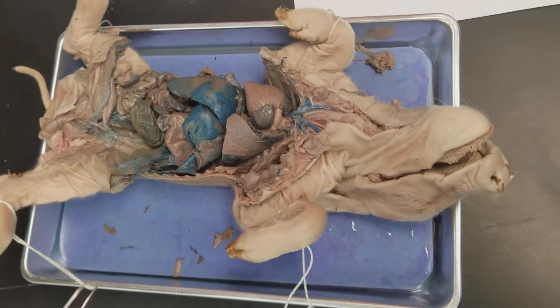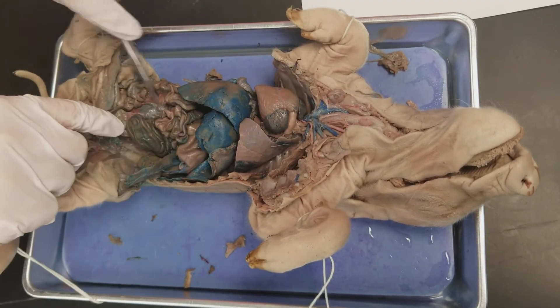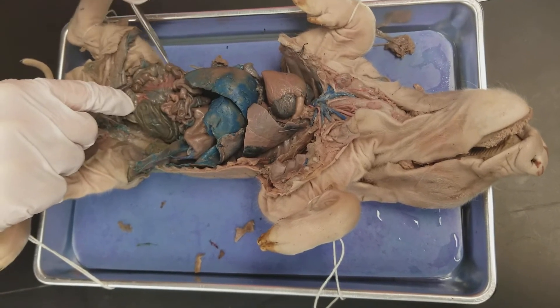The mesentery is what holds together the small intestines — it's this webby stuff that holds it all together there.